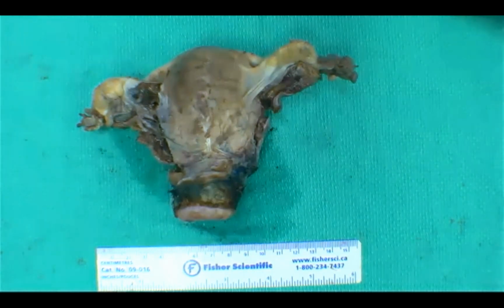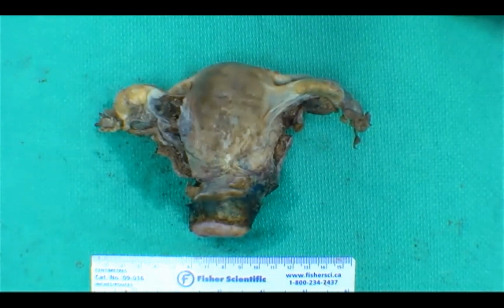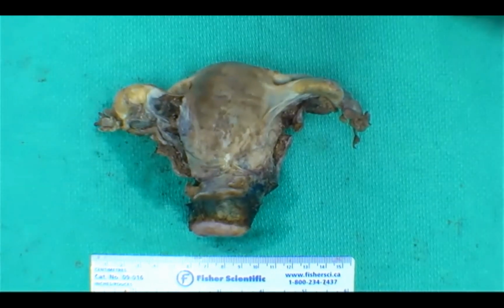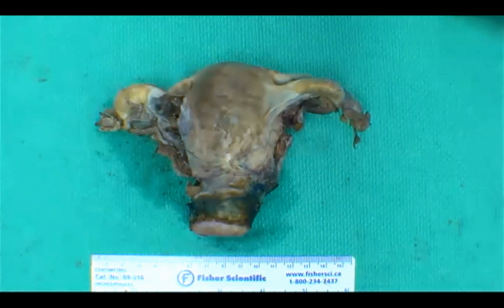Leiomyomas are probably one of the more common specimens that you'll see, and it's good to know the different gross appearances of leiomyoma. There's a question, could this be an adenomyoma? So let me answer that question by turning the question back. What's the classical gross appearance of an adenomyomatous uterus? Yeah, globoid. They're bulky with this lacy, trabeculated look. It's deep within the myometrium, and it's not as very whirly or white.